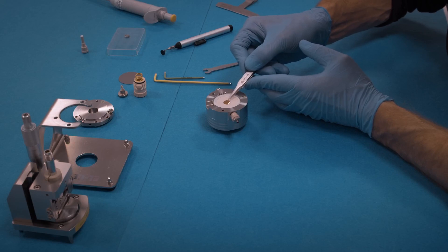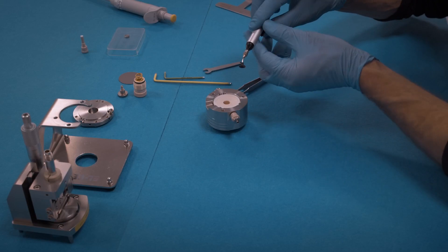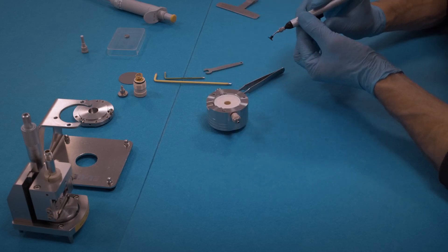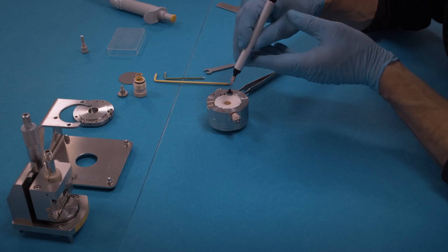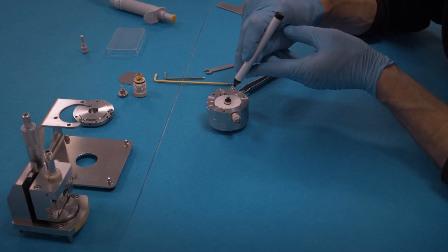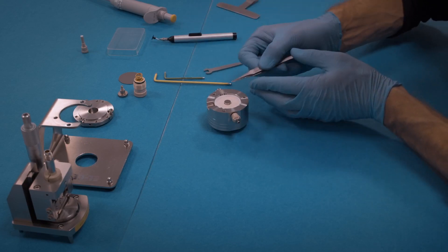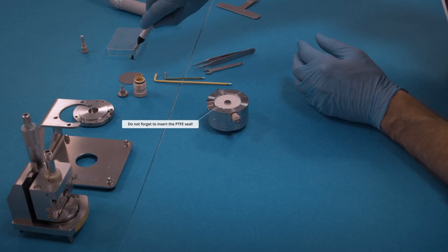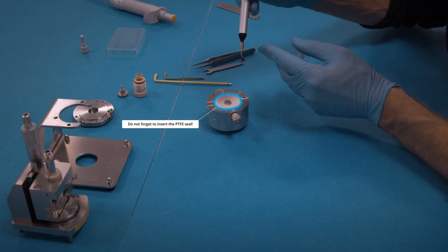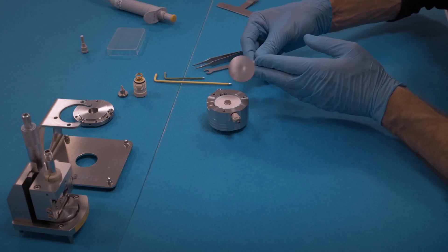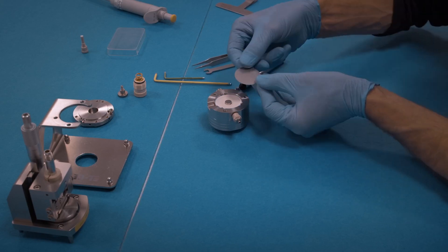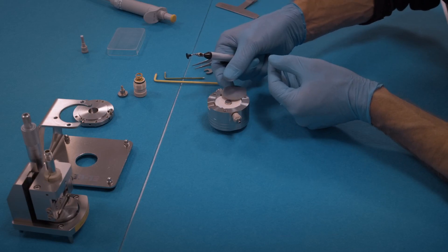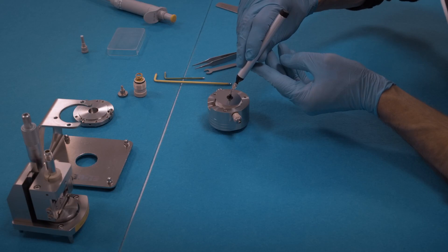Insert the working electrode with the active layer pointing down. Put the spacer disc on top and bring it to the center position. We have already inserted the PTFE seal for the metal membrane. Now place the metal foil on top. Always use a fresh one, dispose after use, and make sure that it is perfectly flat, not bent, and that there is no indent from a previous experiment.